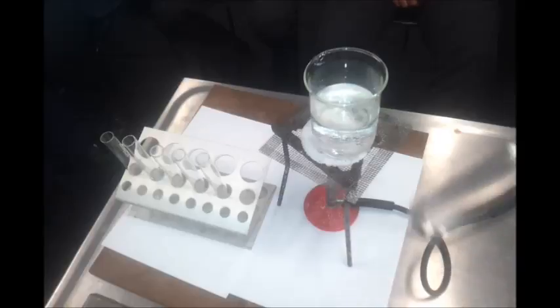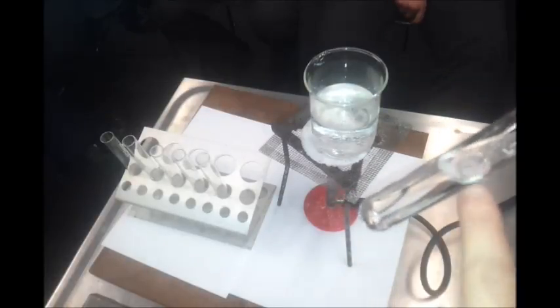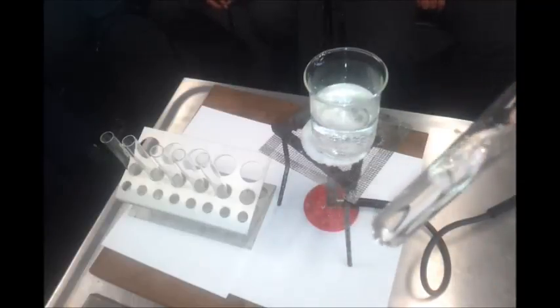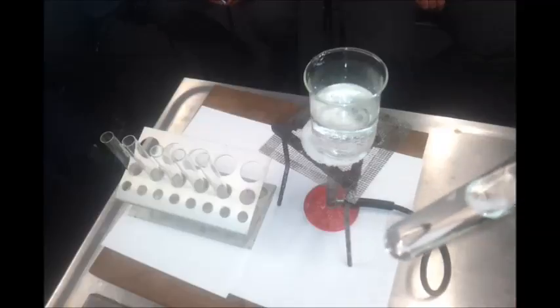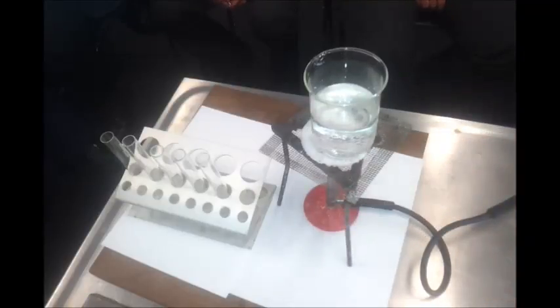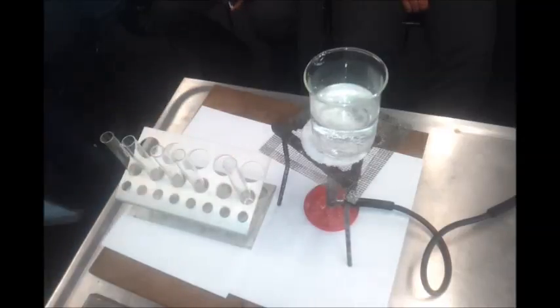And if we have a look there, we can see that it hasn't got a layer anywhere in there, not at the bottom, not at the top. So that shows us that ethanol dissolves in water, and that was that little diagram yesterday, the little dashed lines between it, showing that the alcohols can make hydrogen bonds. If we go to a larger alcohol though, it doesn't dissolve quite as well because of the non-polar end to it.